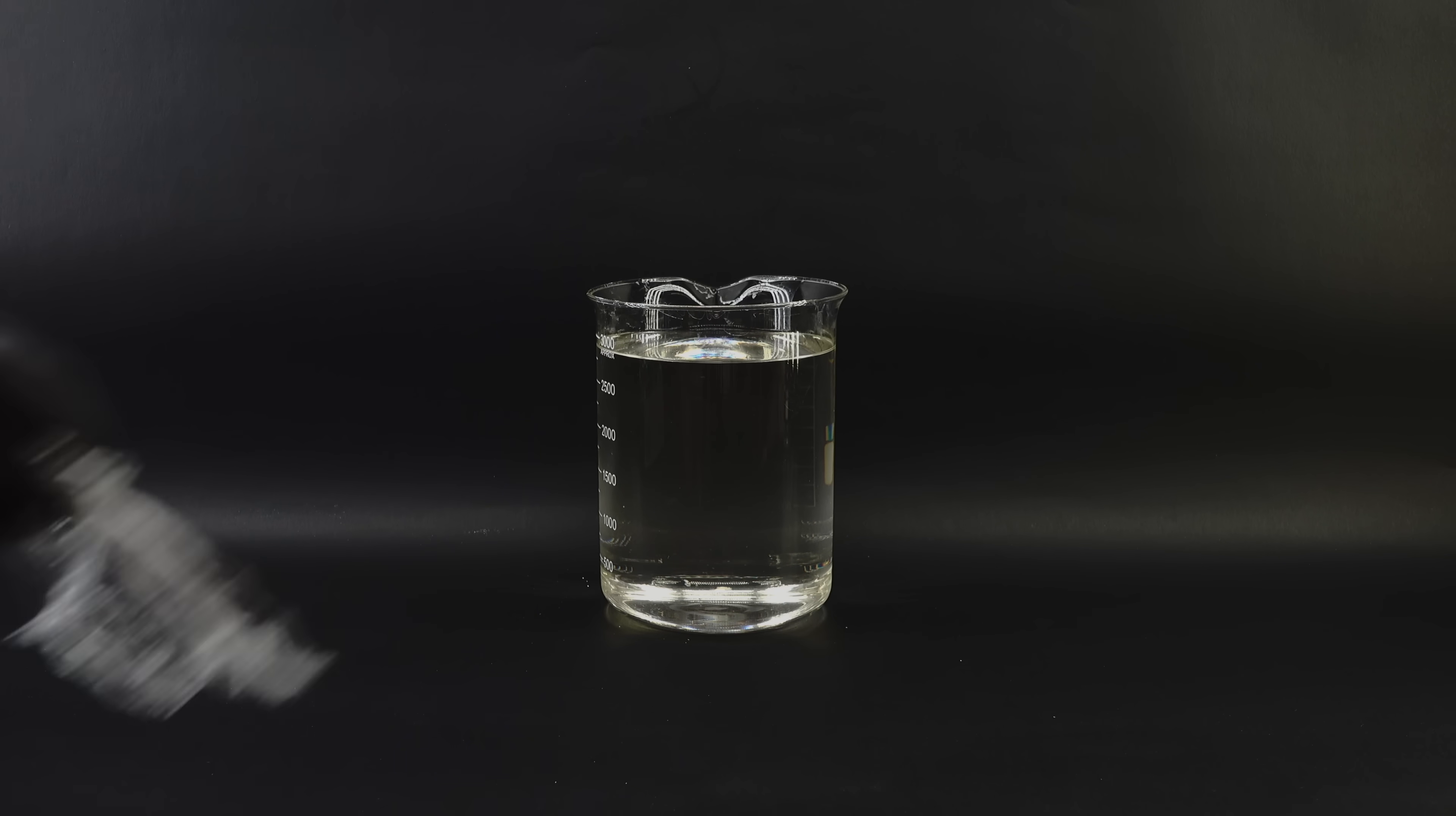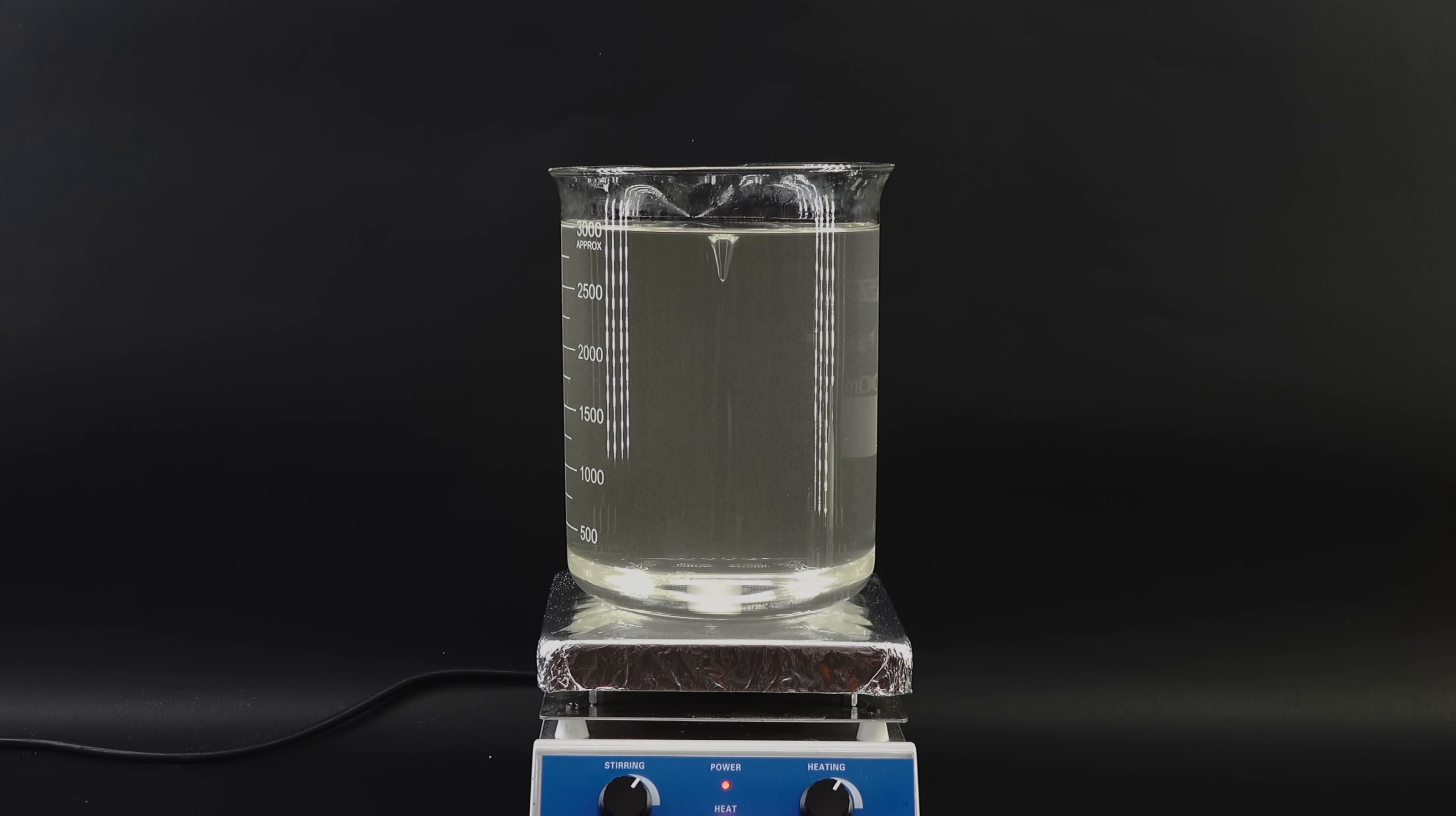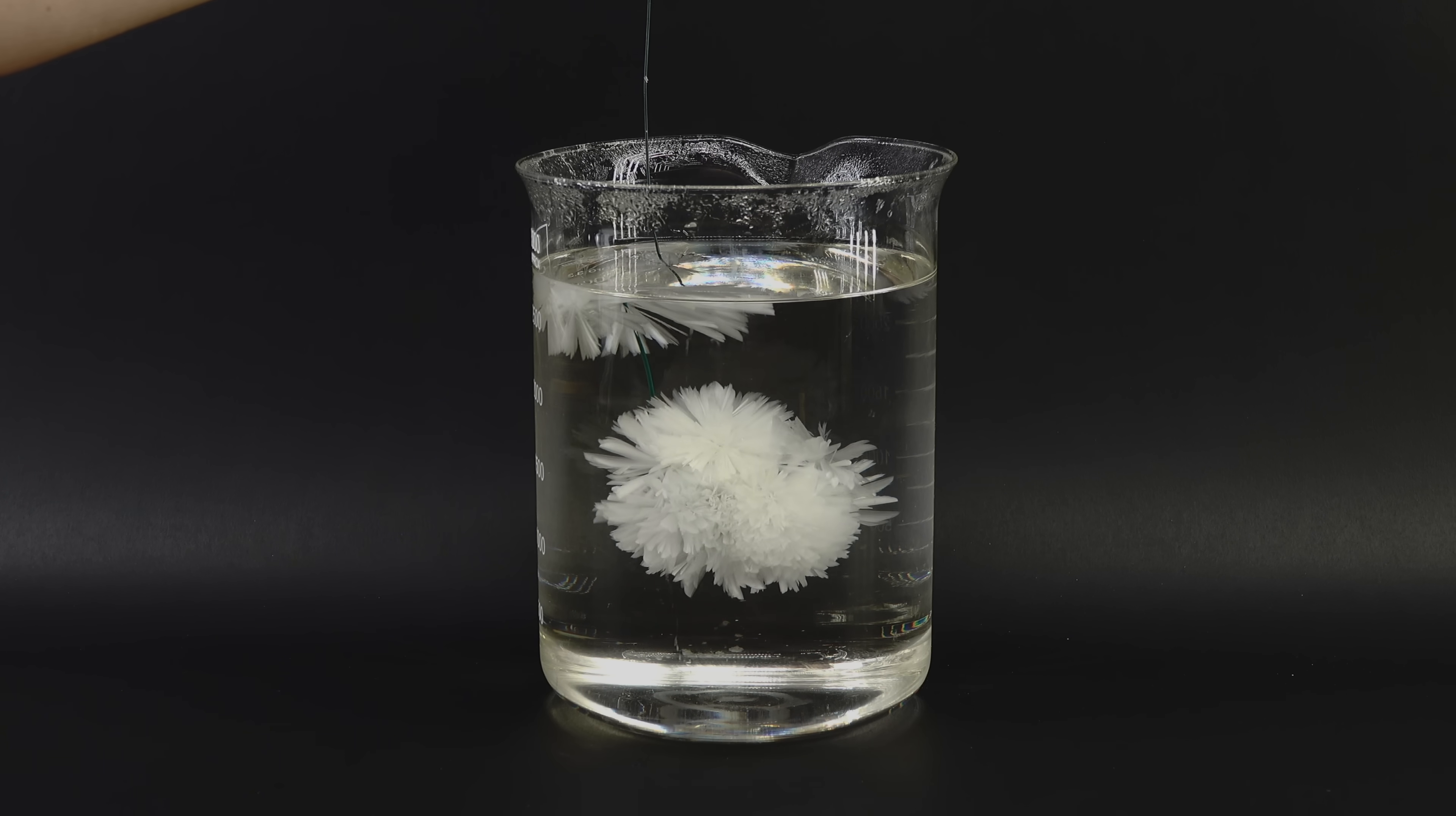Still, it doesn't take much for it to turn back into a solid, since even a stray speck of dust made a whole beaker of this stuff magically turn into crystal. This honestly looks cool as hell, with these gigantic crystal strands appearing seemingly out of nowhere, and what's even better, I can redissolve them by heating the solution, and when I cool it down again, the whole cycle repeats. I had more fun with this stuff than I would like to admit, and after growing some funky towers and submerging many things in the crystal solution, I got the bright idea of putting my hand in there.